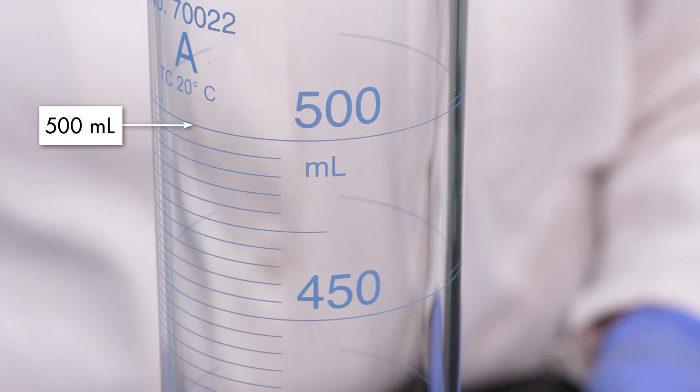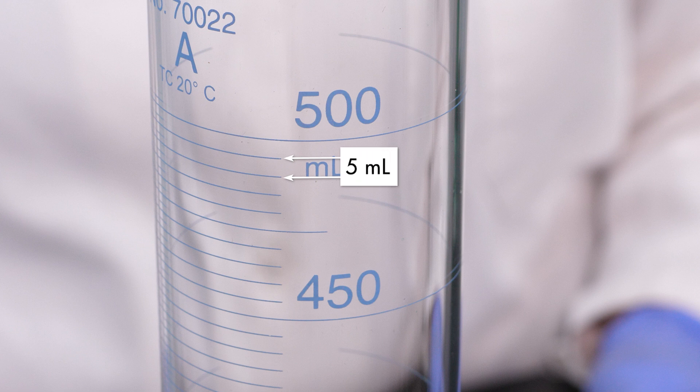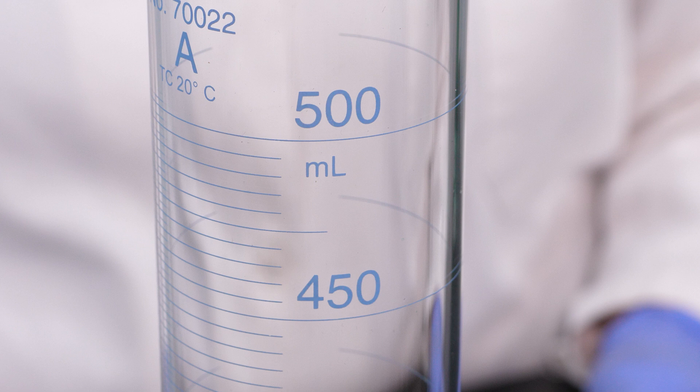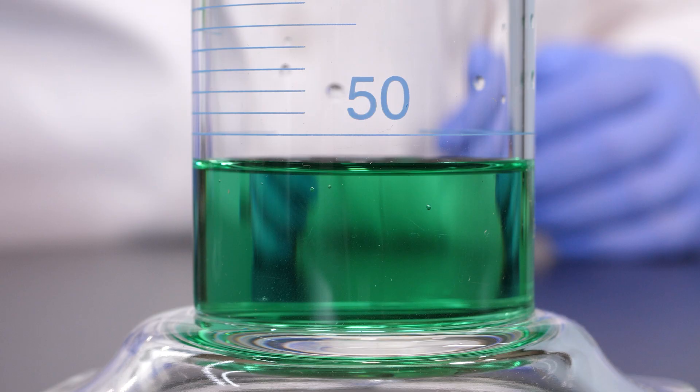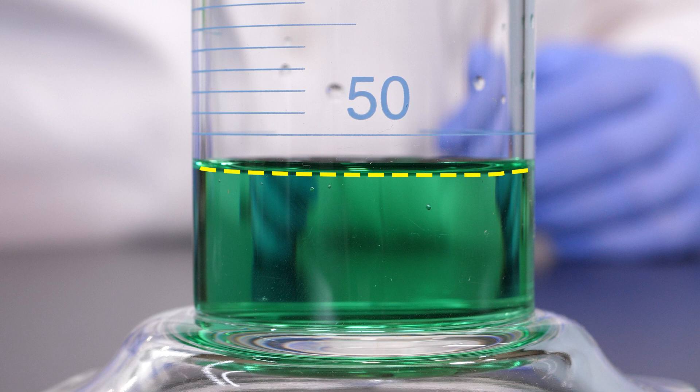The 500-milliliter graduated cylinder is marked in 5-milliliter increments, so its precision is 5 milliliters. Since the increments are smaller, it has greater precision than the 1,000-milliliter cylinder. However, the bottom of the meniscus is again below the lowest marking, so this graduated cylinder also cannot be used to measure the volume of the liquid.